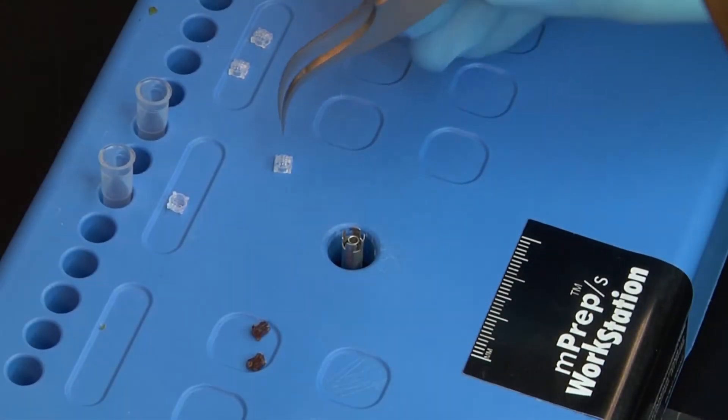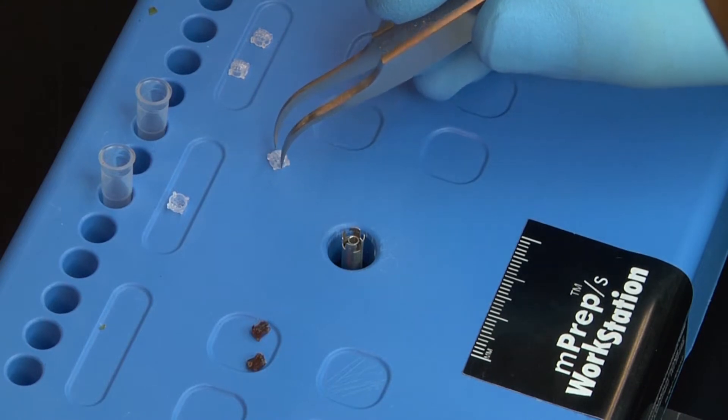A second way to mount specimens is by compression mounting. Of course, the amount of compression can be minimal. First, place a screen into the insertion tool.